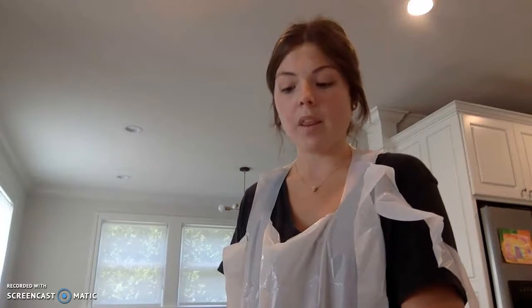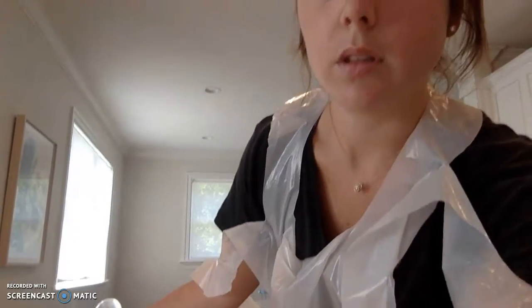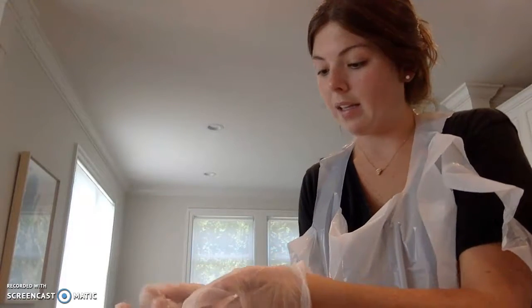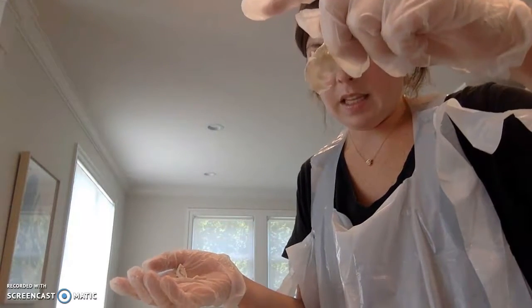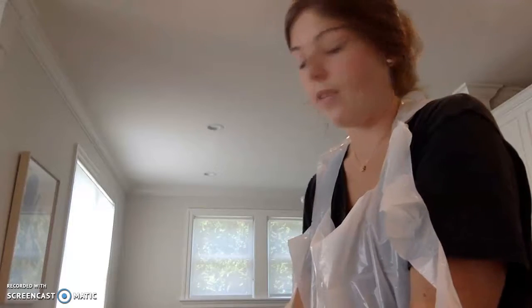So I'm going to start with the meninges, which consist of the dura mater, arachnoid mater, and the pia mater, and that is located on the ventral side of the brain. I pulled those off to locate deeper aspects of the sheep brain, and I can just show you on my gloves right here. This is the meninges, and they are pretty easy to pull off the ventral side of the sheep brain.